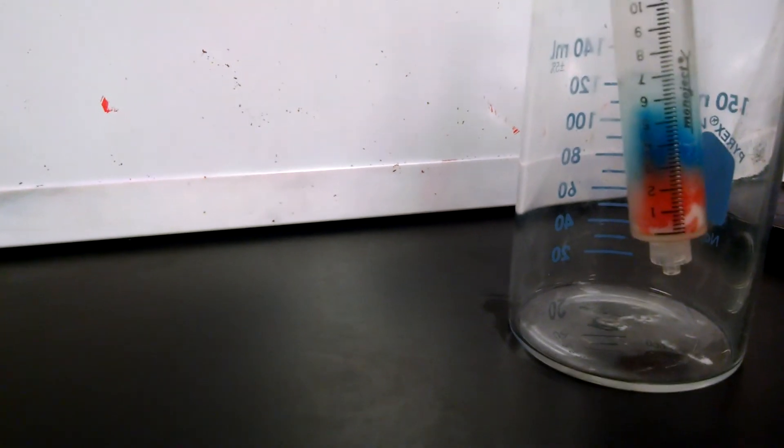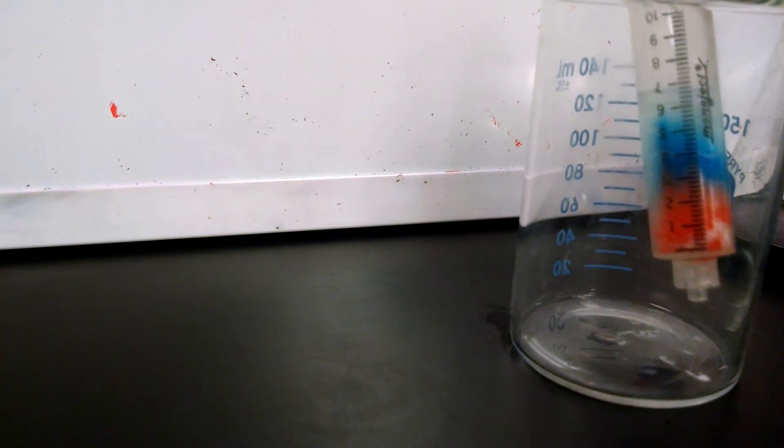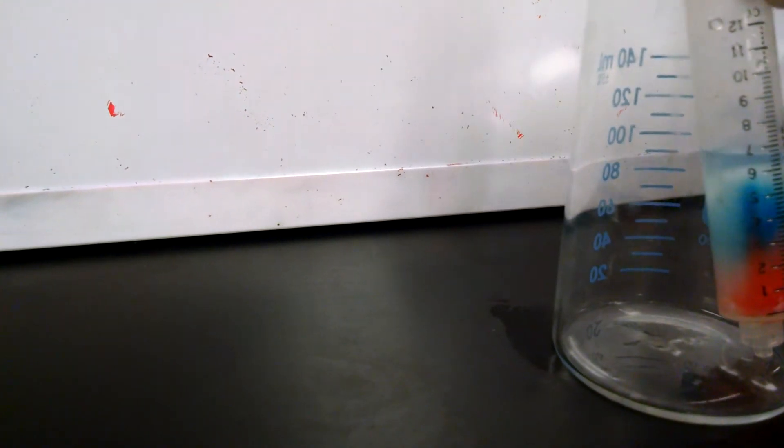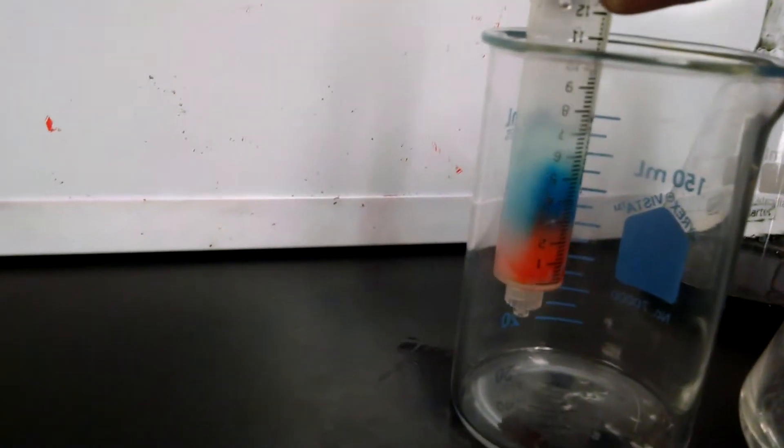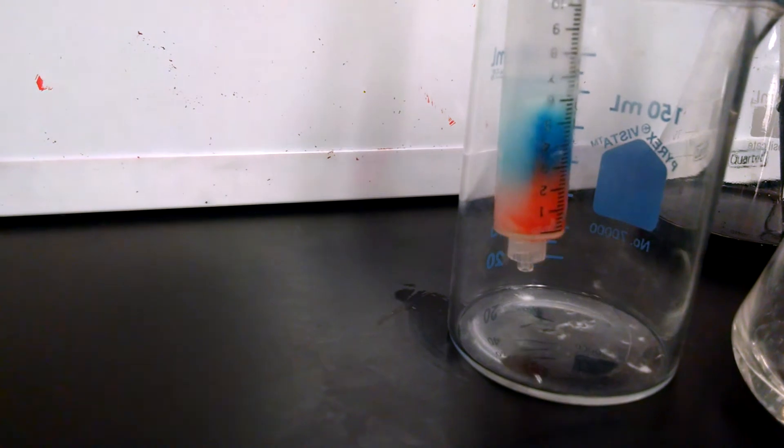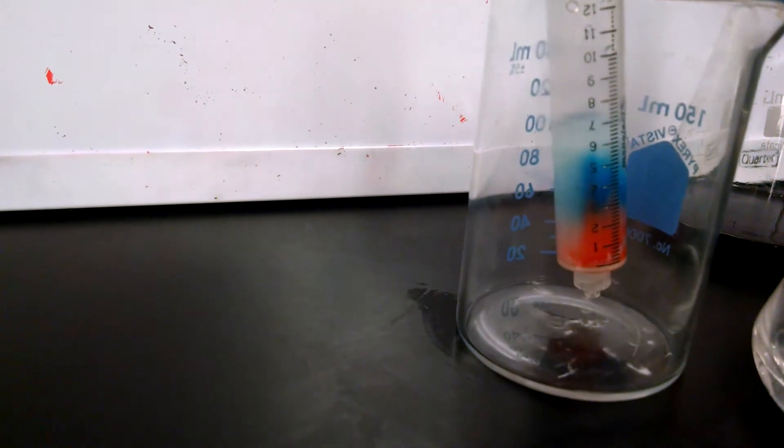And you see that the solution is starting to collect the red color. I'm going to collect the red color in this beaker.